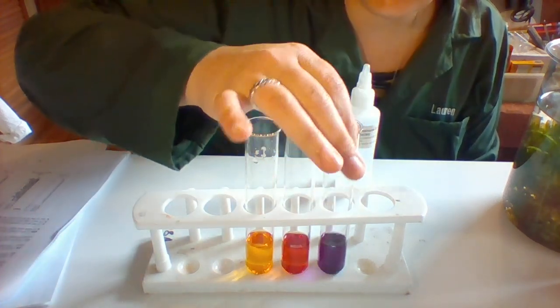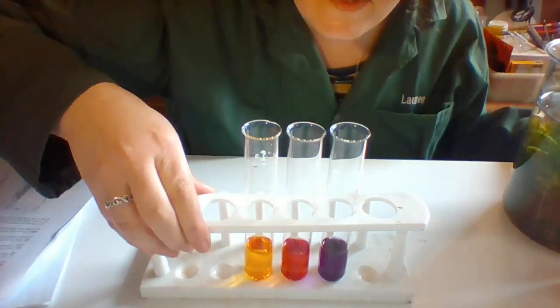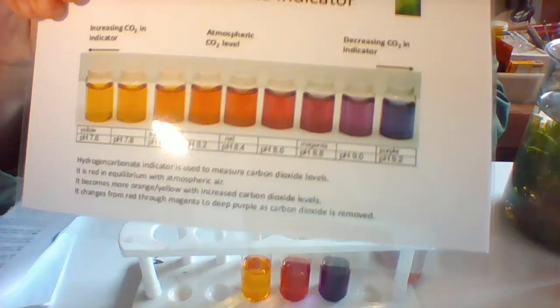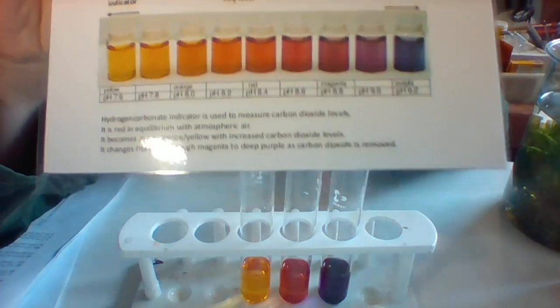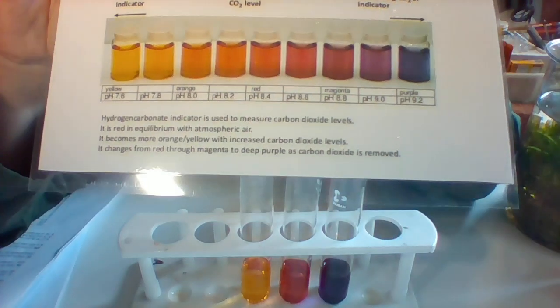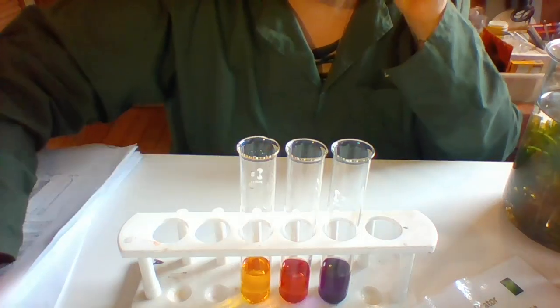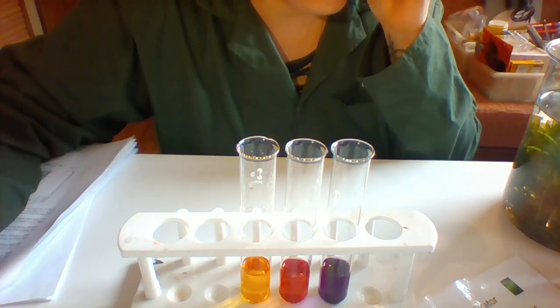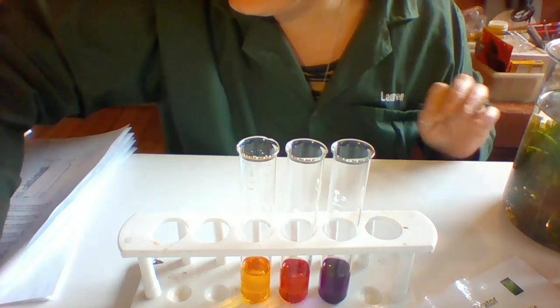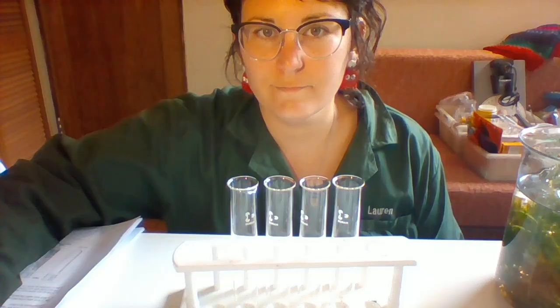Whoa, that did not mean much at all. So can you see that color? So take down what pH you think these are and what that means for what happens when I blow into it. And yes, there are questions in your prac notes that you can answer.